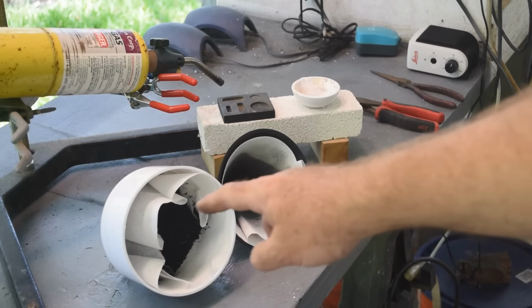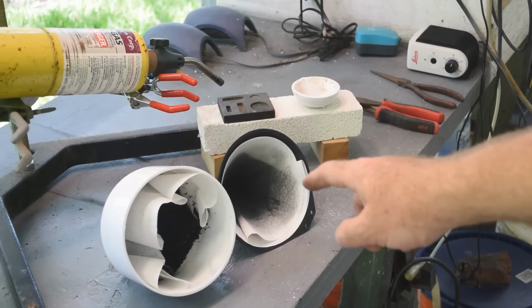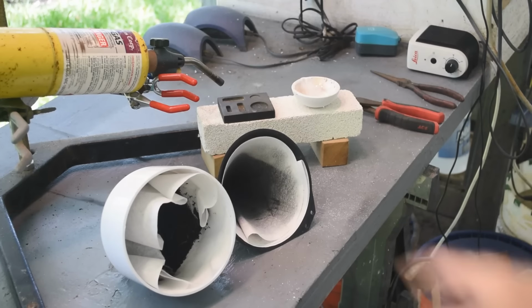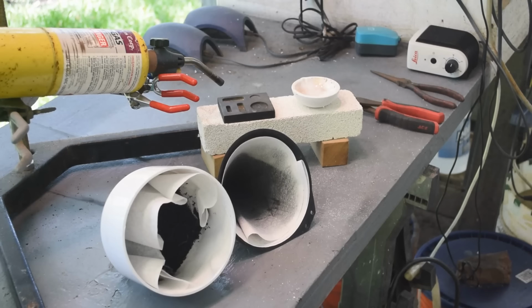The two filters: this one has the bulk of the palladium in it. This one over here is the one I was using earlier in this video, where I was pouring the liquid off through it and it caught some palladium. So I will get both these filters out, wad them up tight, and put them in the crucible there, cover them with some borax, and we'll get started melting and see. Yeah, I'm not 100% certain that my torch is going to get hot enough to melt this stuff, but we'll give it the old college try and see if we can.